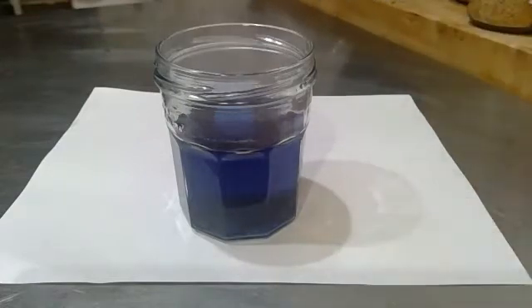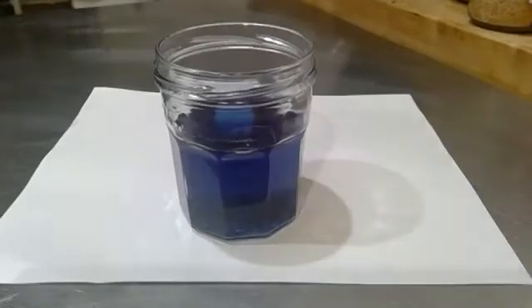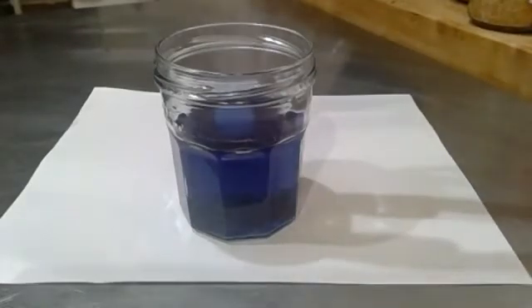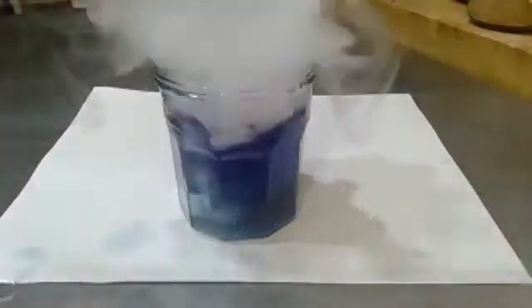Let's drop this CO₂ into this water. Look at it bubble! Watch it — tell me if you see the color change at all. It's turning purple! Is it purple now? Yeah.